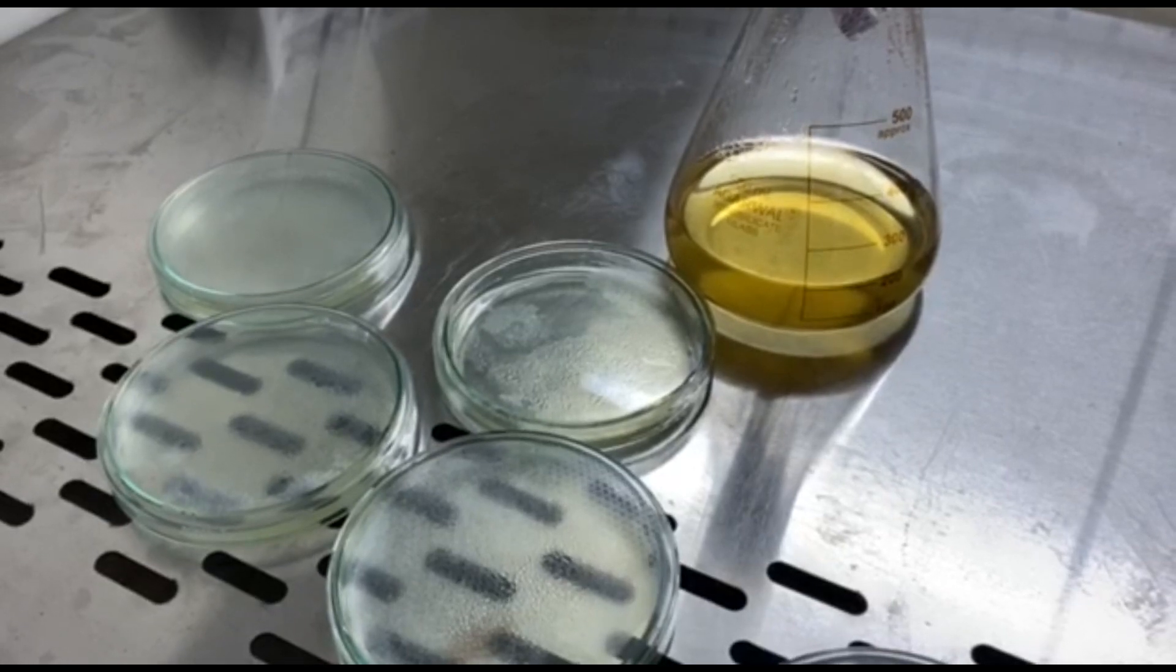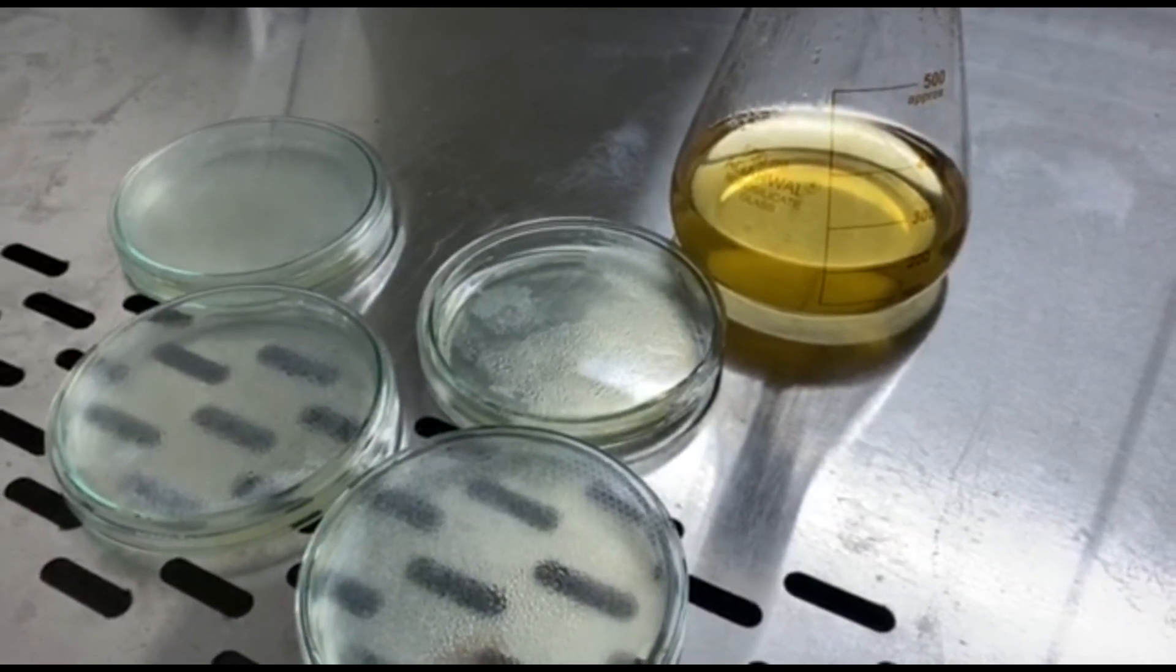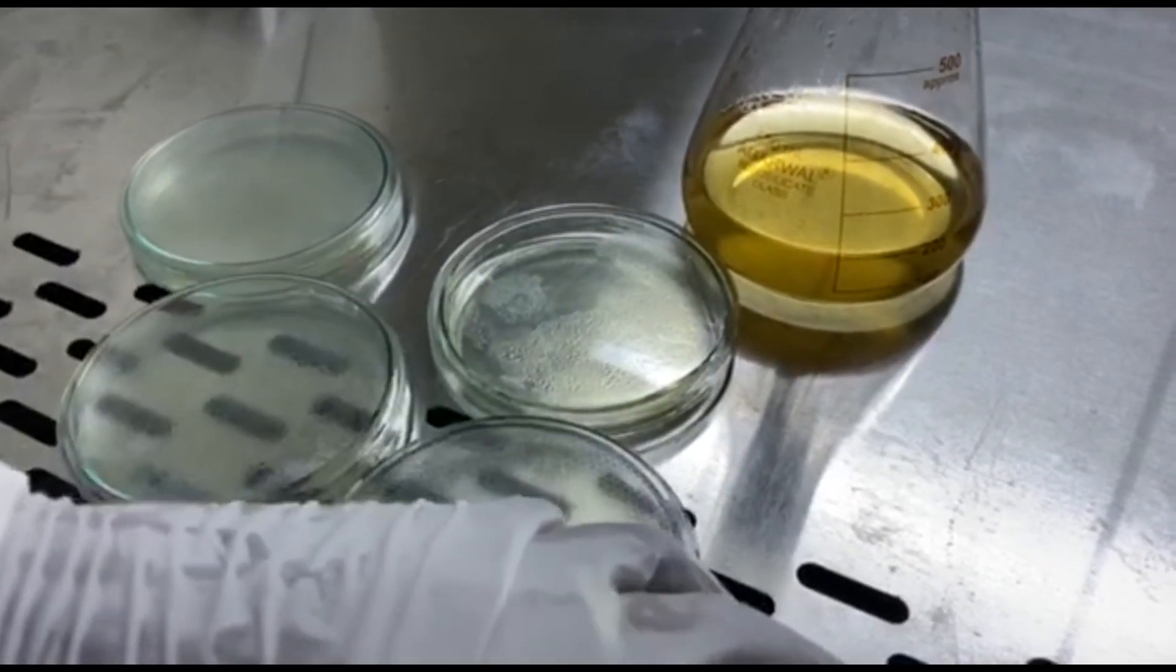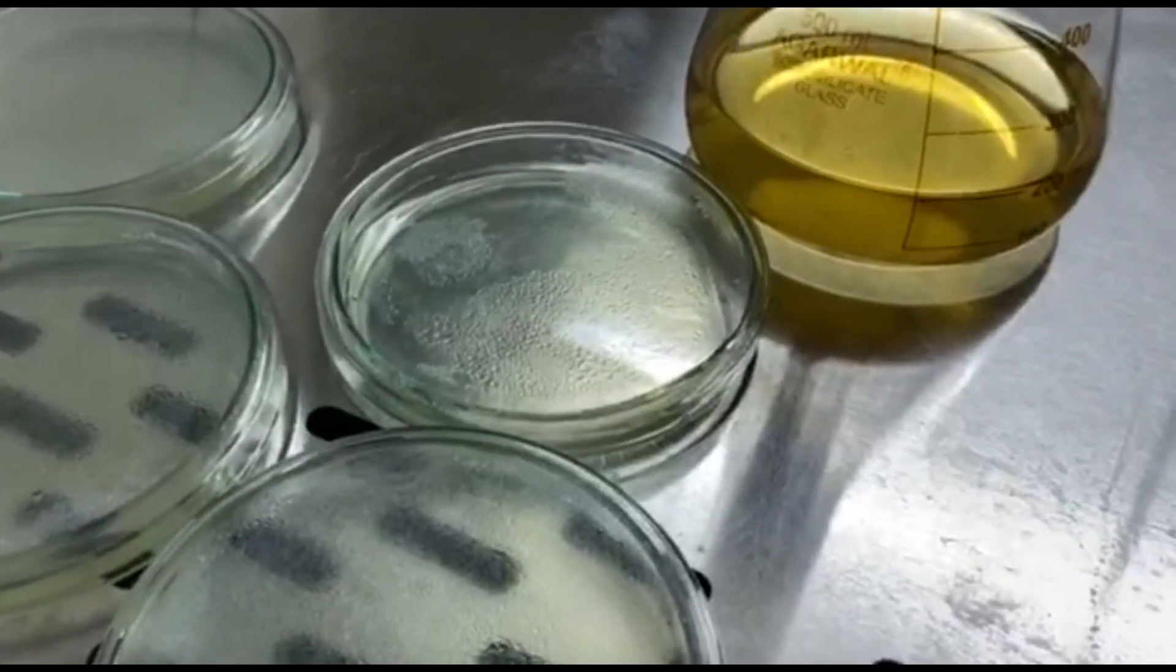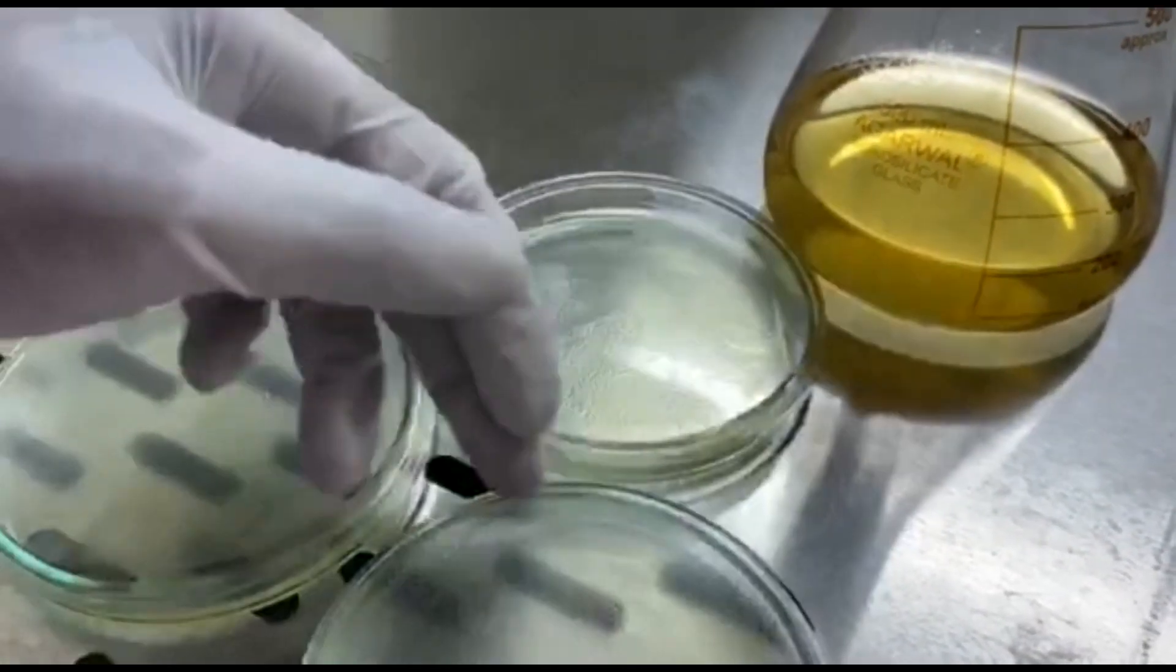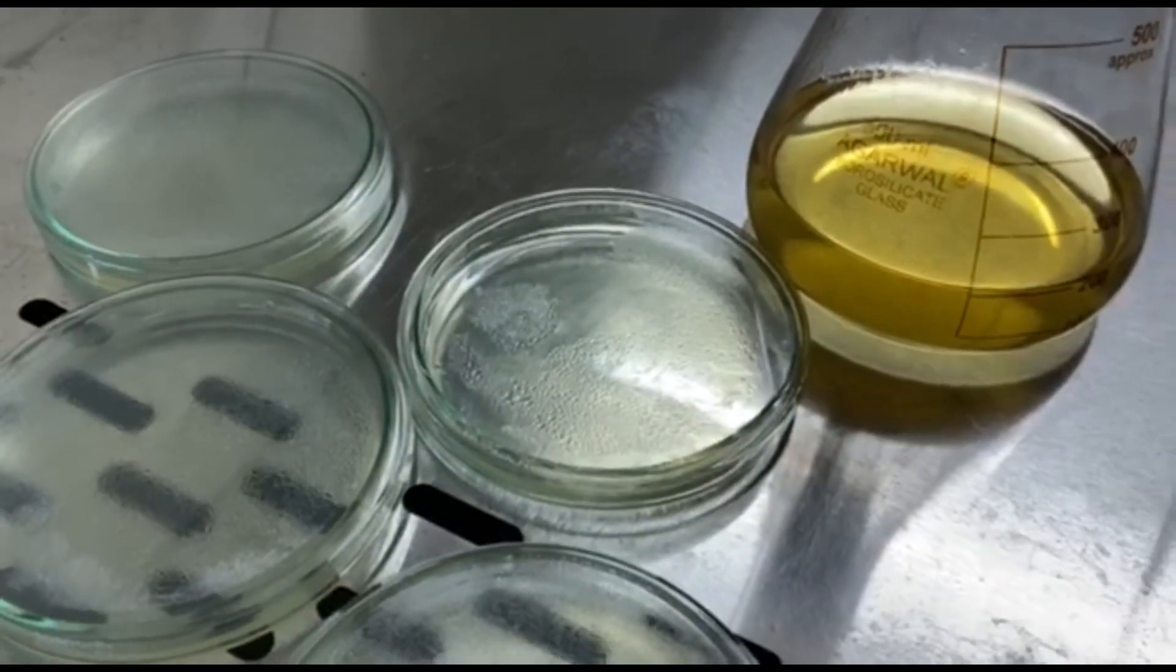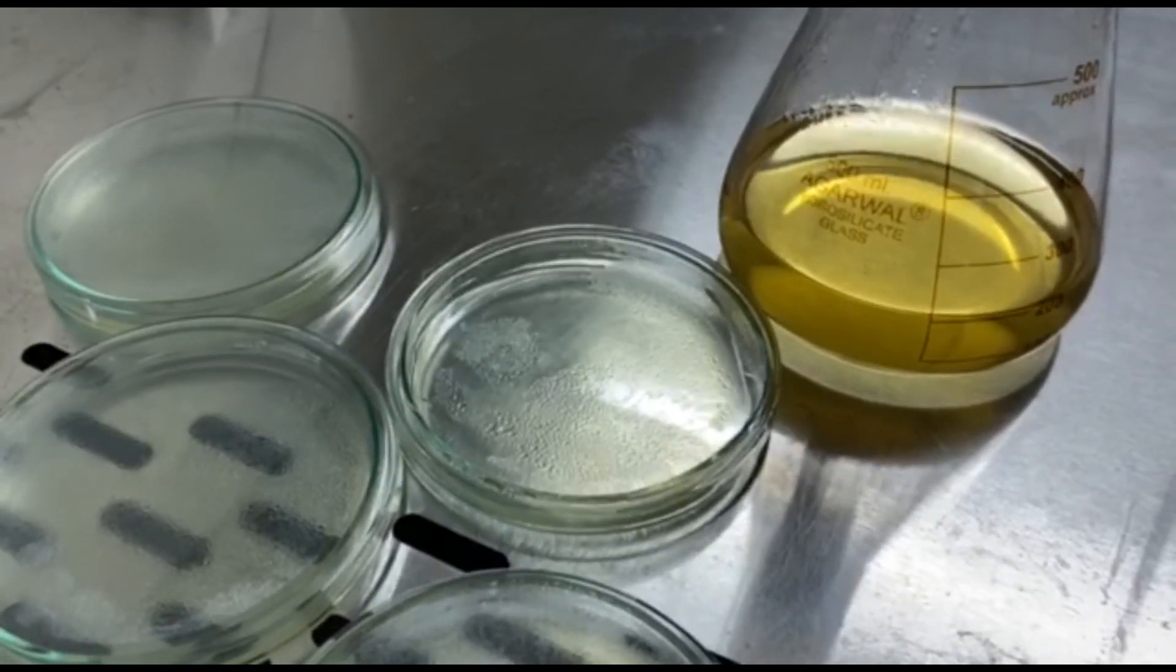So it's been almost half an hour that we have left for the nutrient agar base to solidify. Let us check with the tapping method. And now can you please nudge the plate. Yes. So now our plates have - our agar has been solidified, and now it is ready for the second layer of blood agar to be poured.